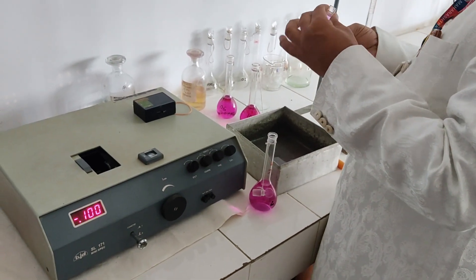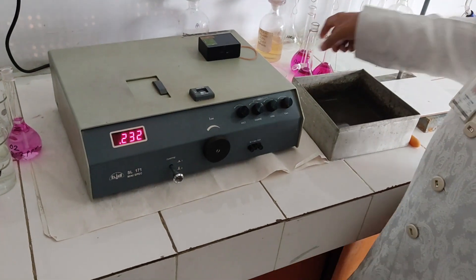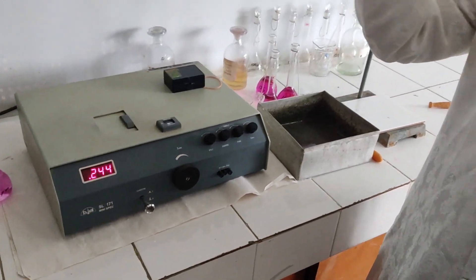The unknown absorbance is 0.246. Now we will plot a graph of absorbance against concentration in ppm. From the absorbance of the unknown, we will find out its concentration, then calculate the amount of chromium present in the water sample. We will also calculate percent error: (experimental value minus theoretical value) divided by theoretical value, multiplied by 100. I will now show you the readings, calculations, and work done by our student in the same lab.